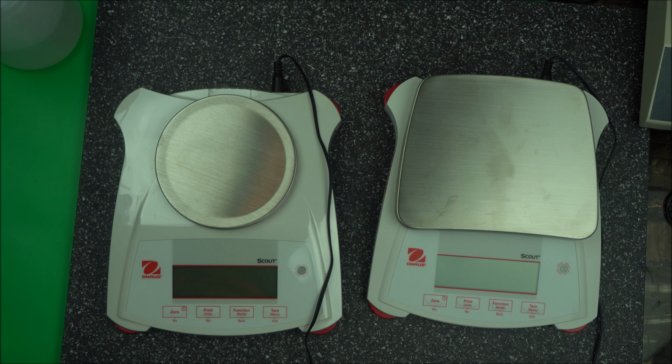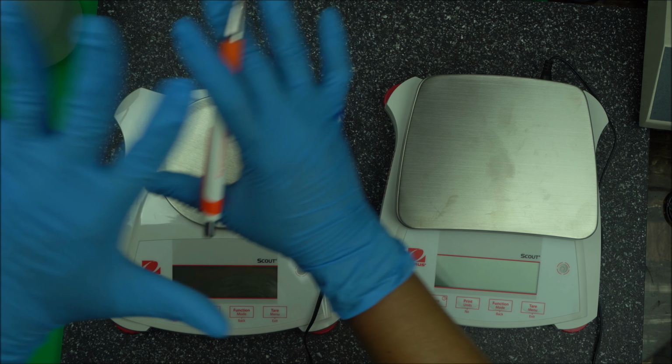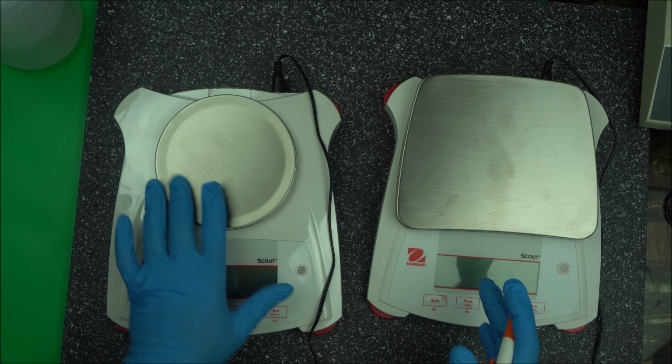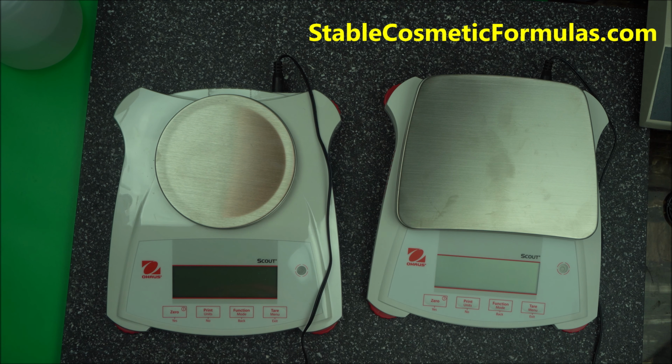So they are powerful, but they are wind sensitive. That's why they come with a cover. Okay, and they are always little and tiny because you're taking small amounts. So when you're using a precision scale, like I have here, these are two precision scales I always recommend, and don't worry, I'm going to tell you about them and where you can get them. I'm going to link them in another video that I'm going to do. So basically that's about it for this video.